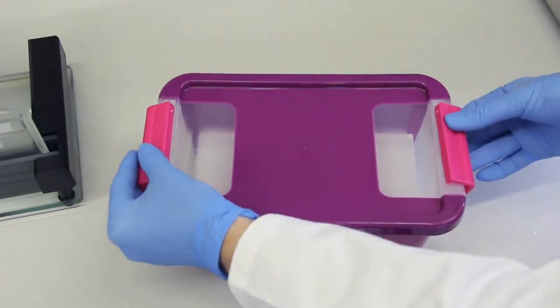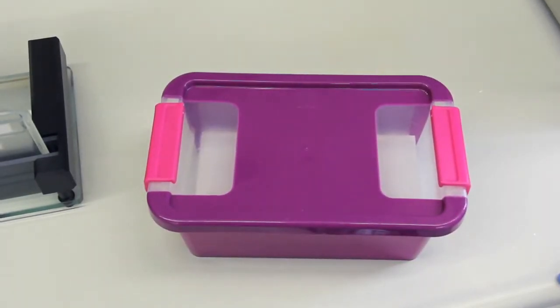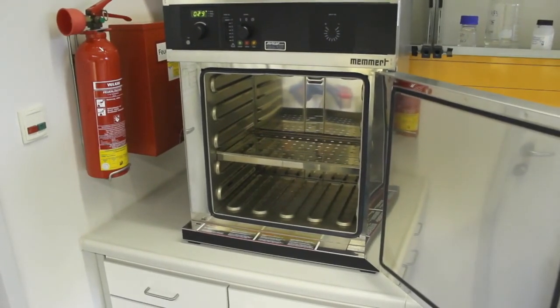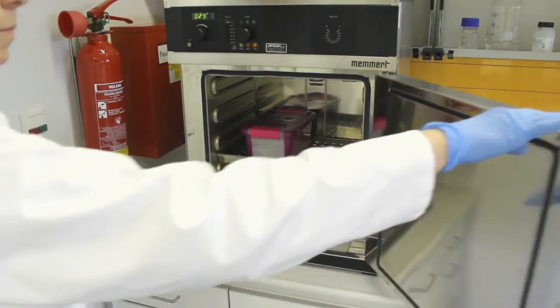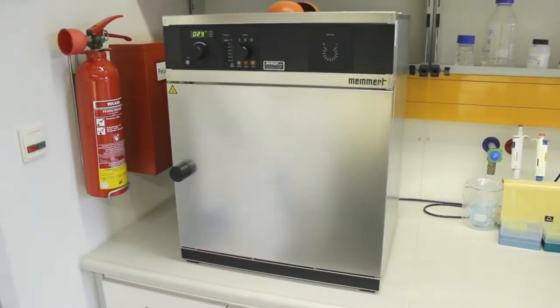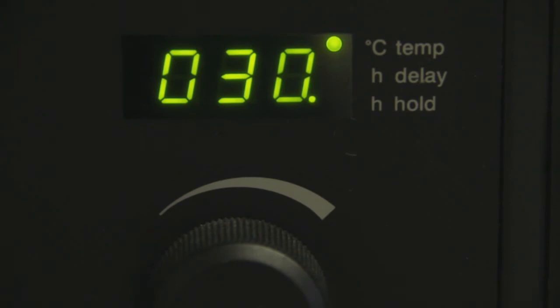The box was lined with filter paper, wetted with deionized water and stored at 30 degrees in the incubator 1 hour prior. During the incubation, any estrogen effective compound zone in the chromatogram that interacted with the human estrogen receptor finally released galactosidase. In the incubator, the incubation of the plate was performed at 30 degrees for 3 hours.